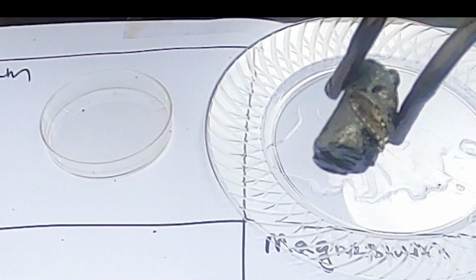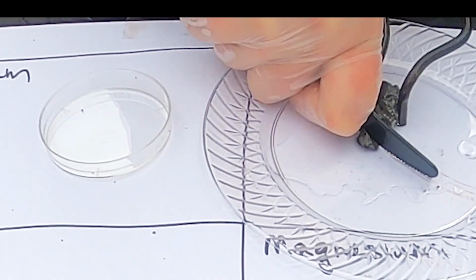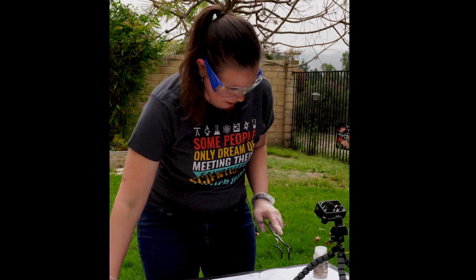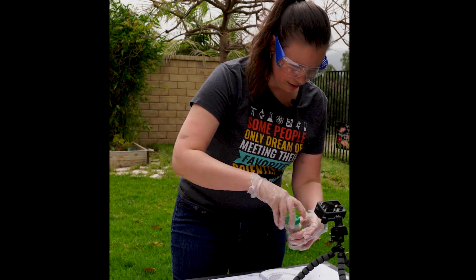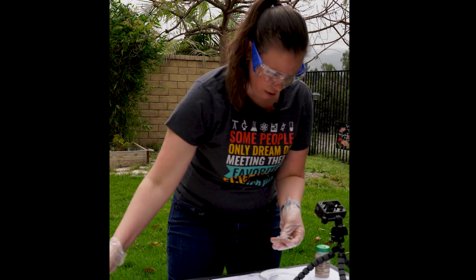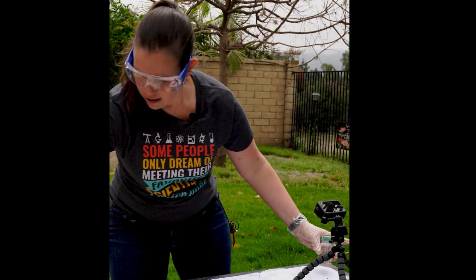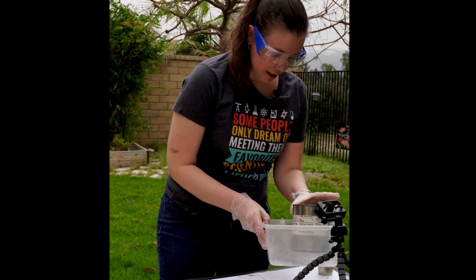Shiny, shiny, shiny for the lithium. Now I'm going to cut off just a small little piece to put in my petri dish and put the rest back in the oil. And then I want to seal it back up immediately in the oil. Sealed back up. I'm going to put a fresh piece of parafilm on it so that it just stretches and fits to make it airtight again. Then I want to put it back in the box. Back in the can, I should say.